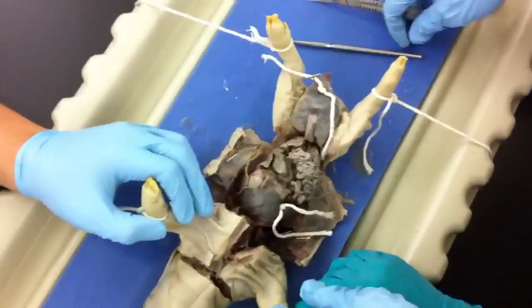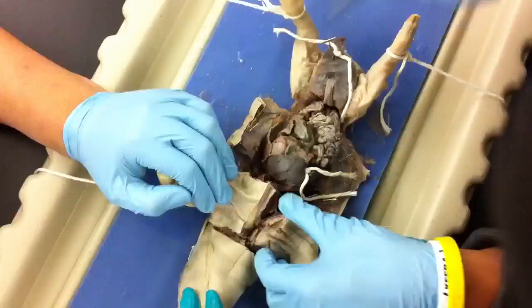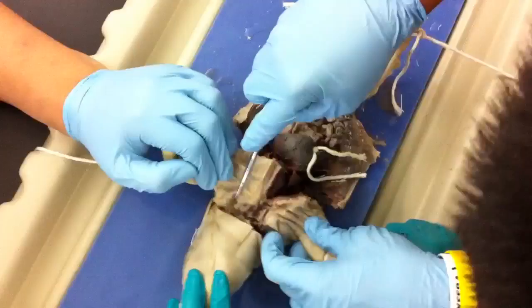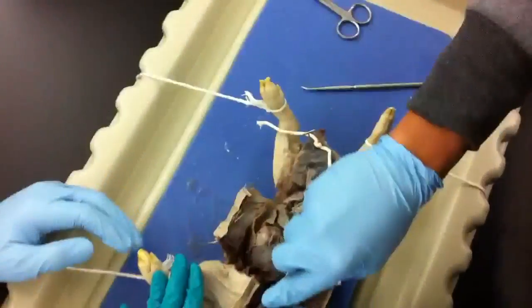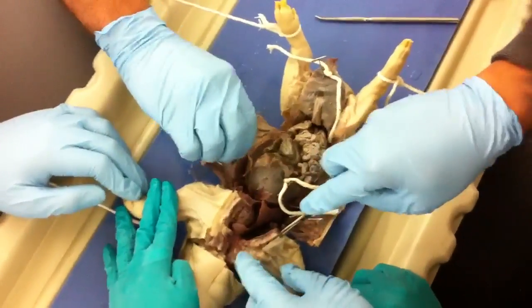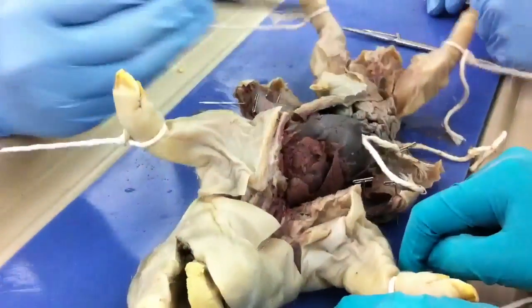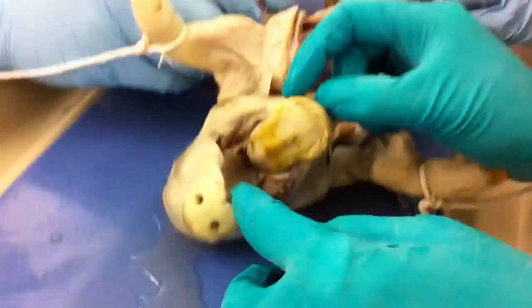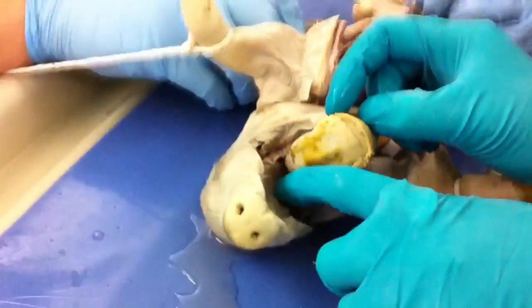I'm a paparazzi over here. Did you guys title it? How do you do this part? I don't remember. Oh, you just cut an artery. He's dead already. You give up? Yeah. Let me try. Stab him. He likes the mouth — it's got like developed teeth. I want to see the brain though. I kind of do too. Let's do that soon.